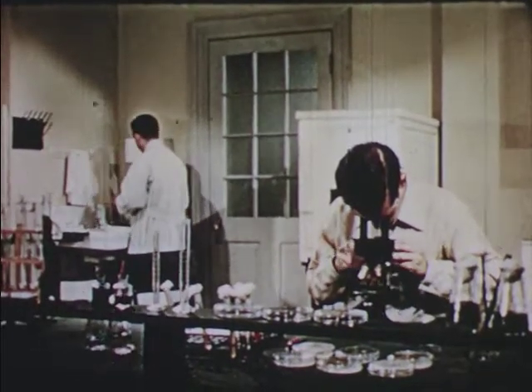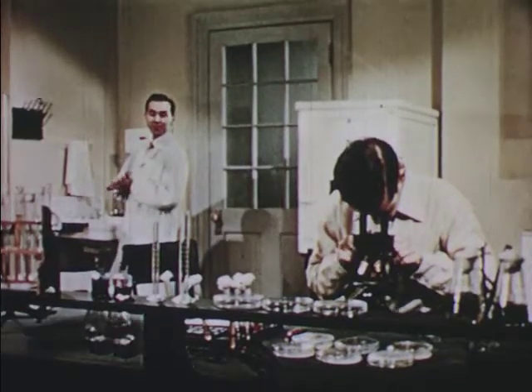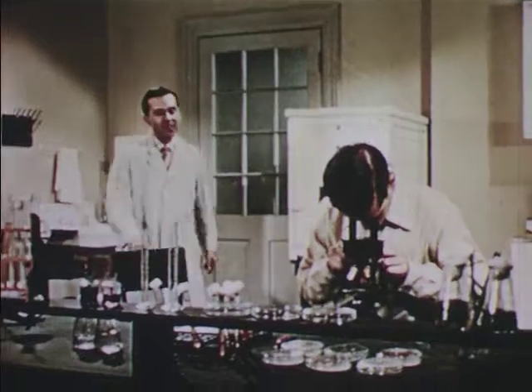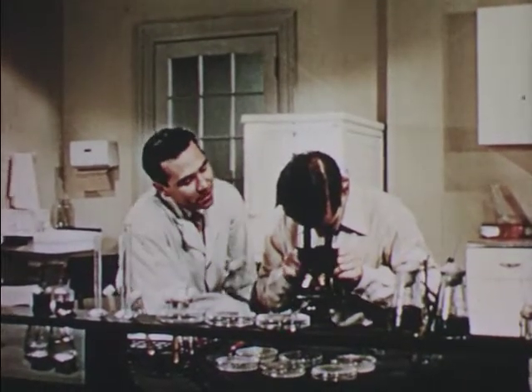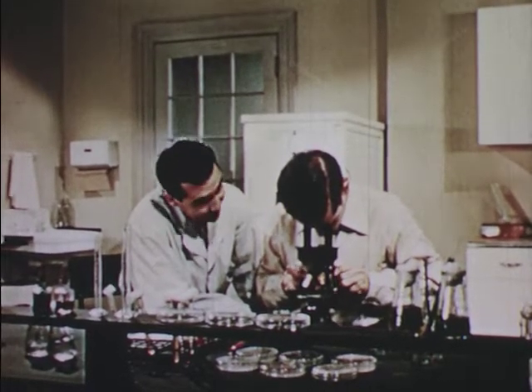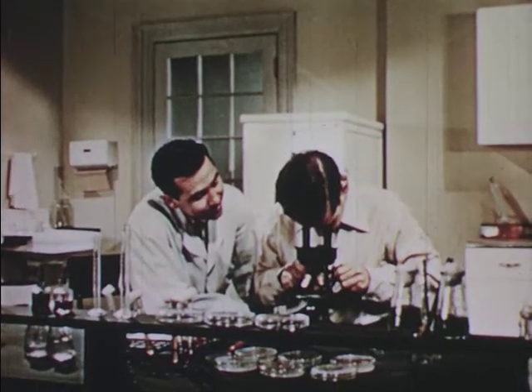Department. Ted seems to be having a little trouble. Can't you get it focused on the field, Ted? Try using the fine adjustment knob, and do it more slowly. You're likely to miss the cells you're looking for, even though they may be there. Okay, I'm trying.